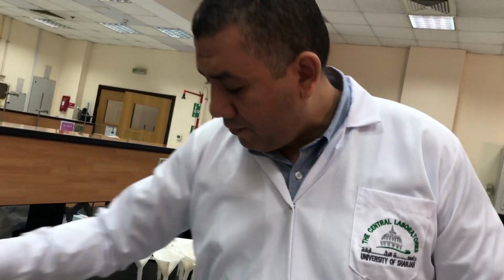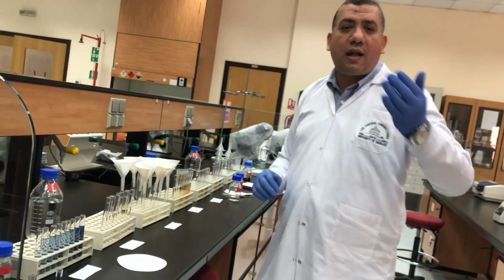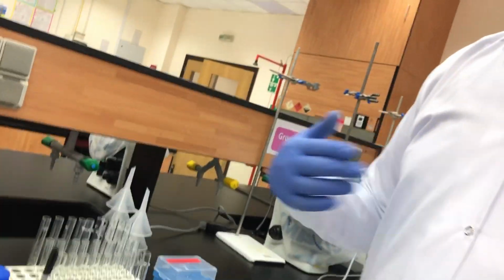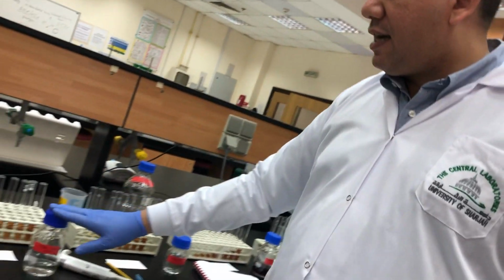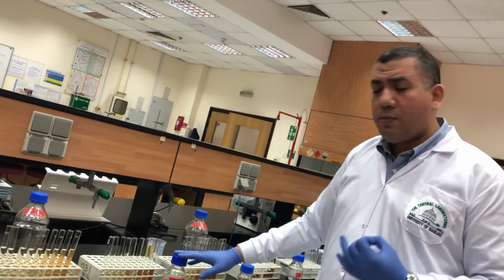So here again, guys, now we have proved it. So we remove it from the spectrophotometer. I will make a small brief. As usual, we start with the setting of the tubes. We add the protein as per the table. We add the HCl for making the media. After that, we add 1 ml of pepsin, and we accurately set the timing to 10 minutes.